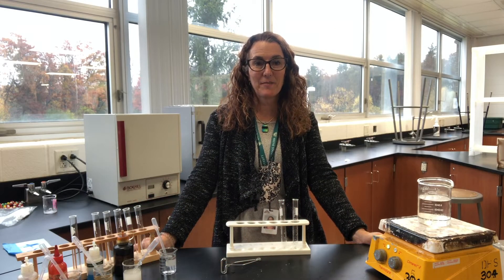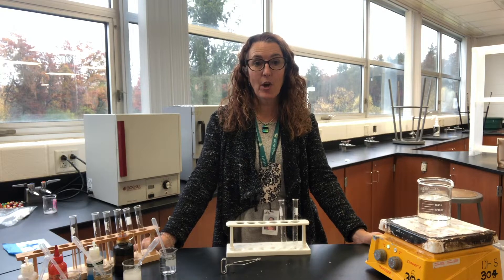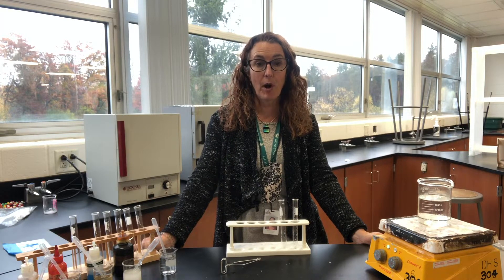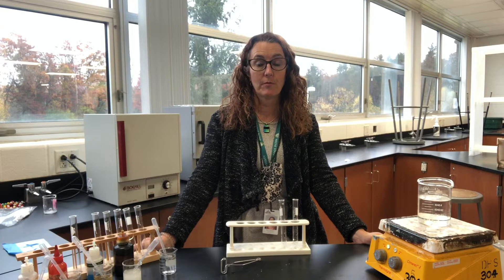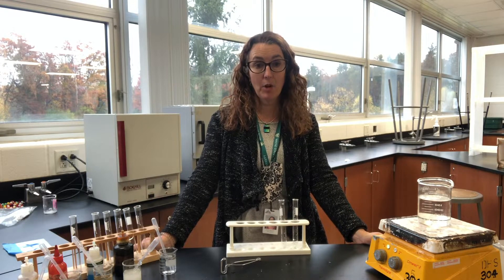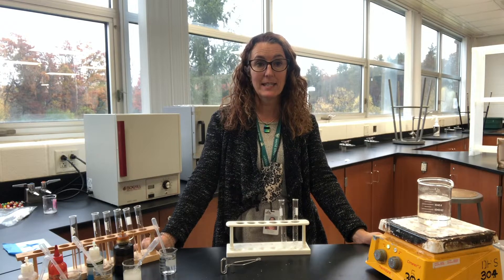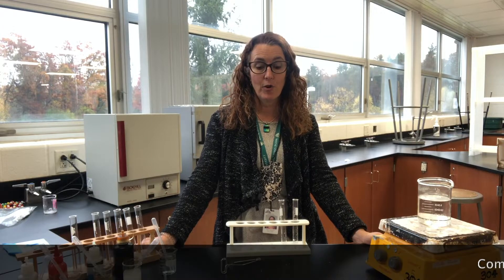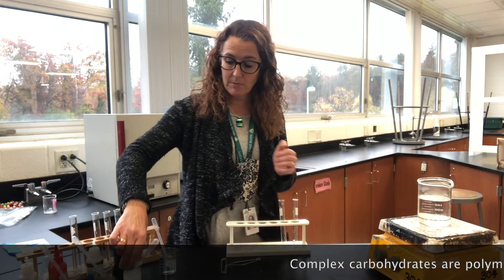Hey everybody, this is Mrs. Hamilton and today we're going to do some biomolecule testing. We're going to test for complex carbohydrates, simple carbohydrates, lipids, and proteins. First, we're going to start off with our complex carbohydrates.